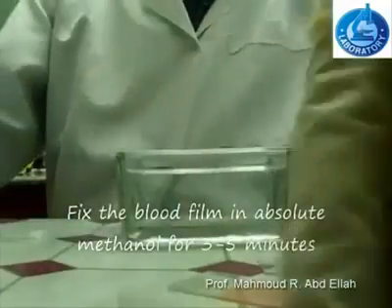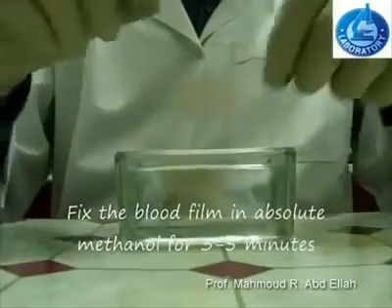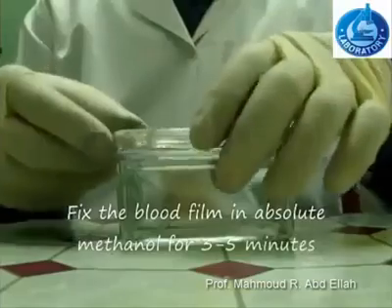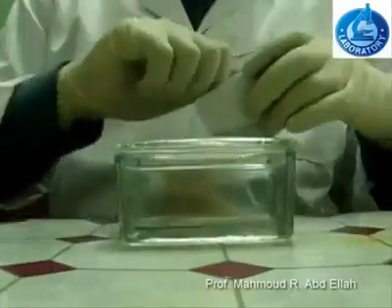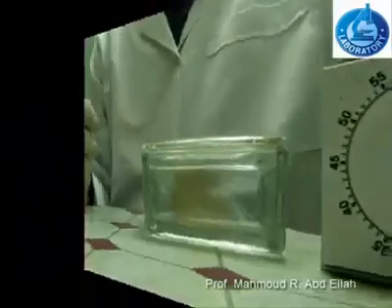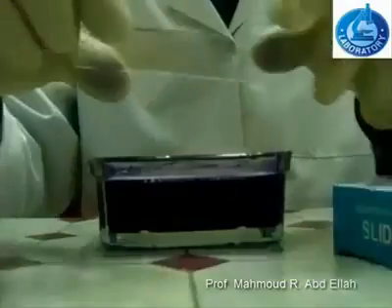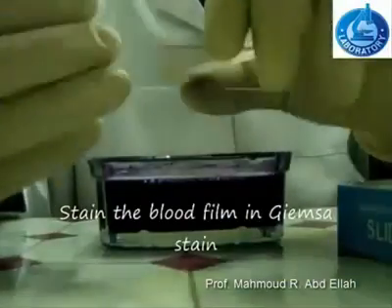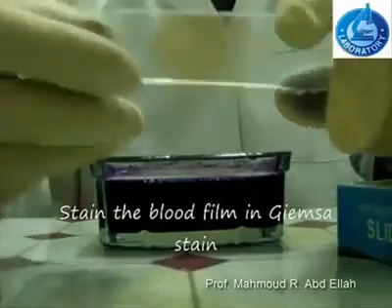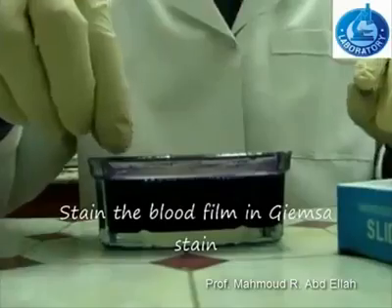After that, fix the blood film in absolute methanol or ethanol for 3 to 5 minutes. Remove the blood film from the alcohol and wait for it to dry. Then stain the blood film in Giemsa stain. The Giemsa stain used here is 10% Giemsa stain. The blood films are allowed to stand in the stain for 40 minutes.